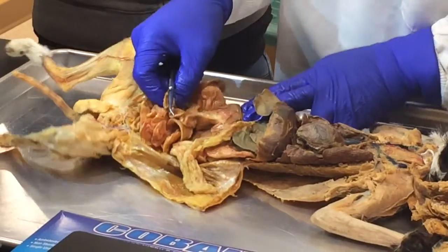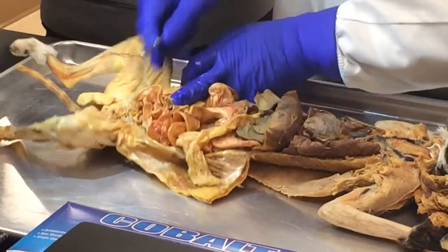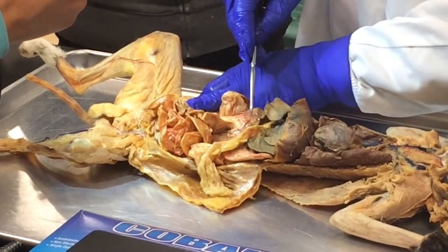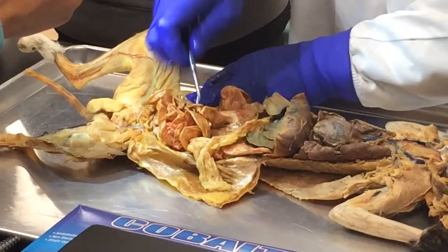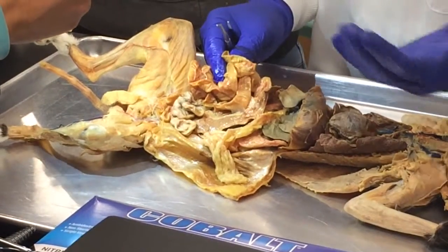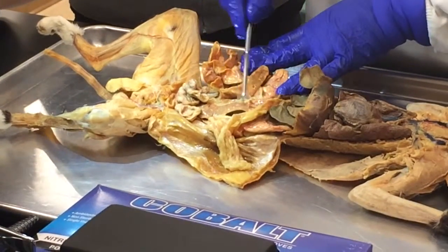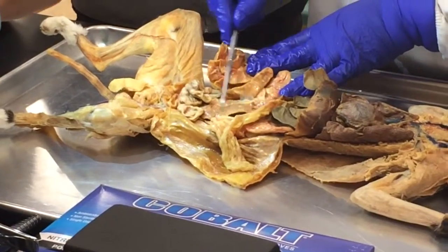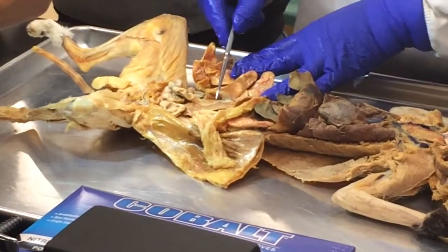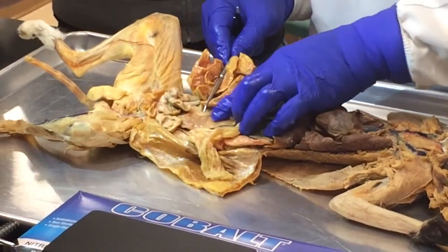And then, of course, if I put a sticker right by the band, you see the band? So this band would be, I'll put it like right there using safety pins. This will be the transverse colon, okay? Then we go like that. So in the exam, you may have to have one glove and be moving this because some of the tags will be covered. And you can see here, if I put a sticker anywhere in this sort of vertical one, that's the descending colon.